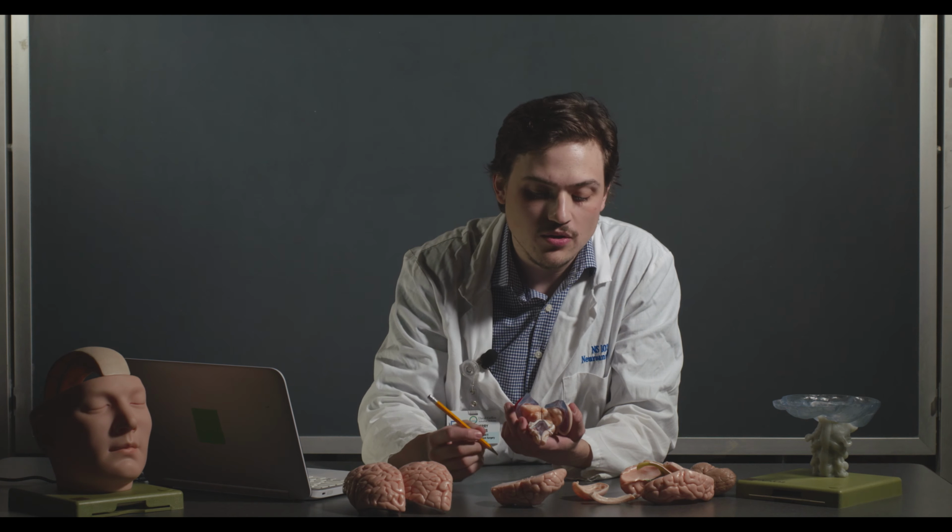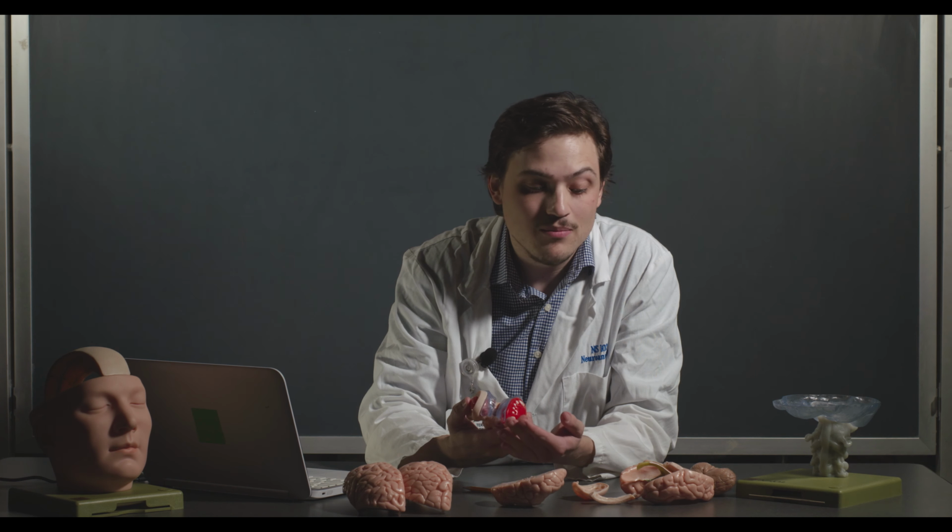You don't need to know all of it today. Just focus on what's bolded or circled in your lab manual. But by the end of the lab series, you will be able to identify all of these structures, name them, and even talk about a lot of their functionality.